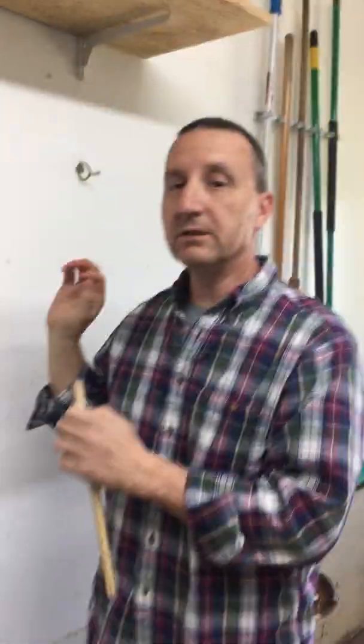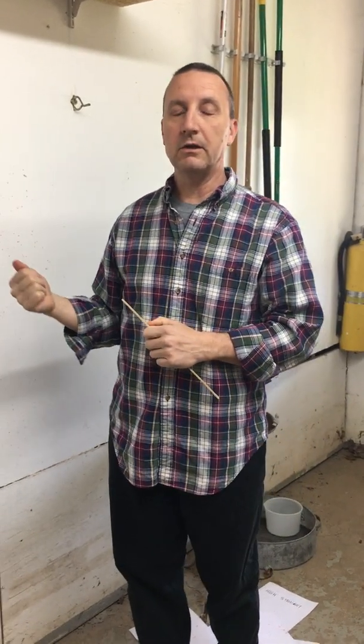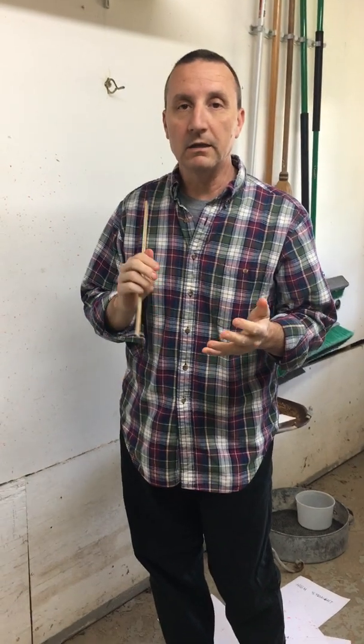Okay, so the thing we wanted to emphasize about this is the size of the drops compared to the speed of the wound, the velocity of the weapon that's causing the wound. All right, so let's do the same thing, make our measurements, make our calculations. You do all of this data today, and tomorrow is going to be calculations to finish the data table and the questions. Okay, good job. Good luck.